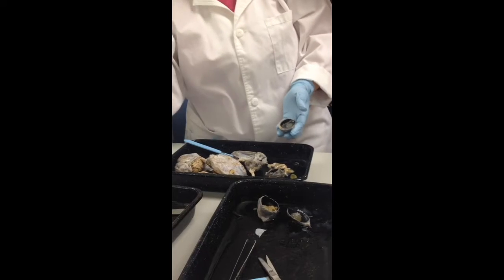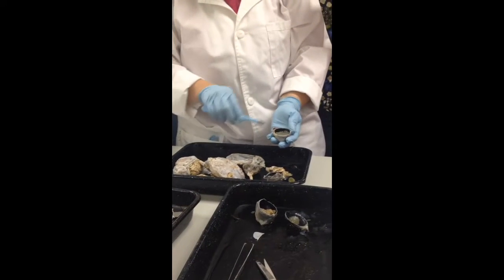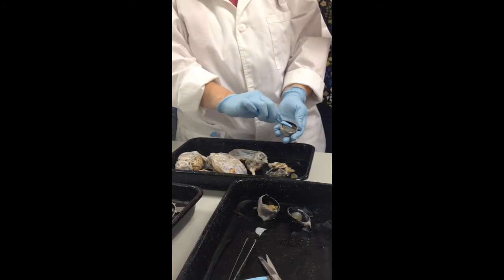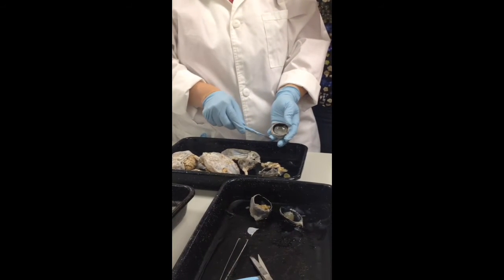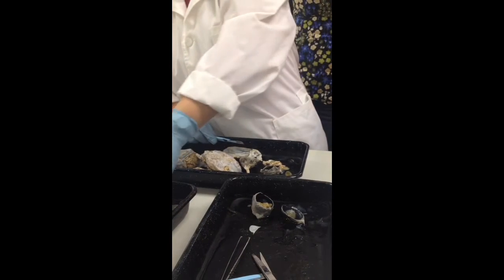Okay, now here you see this nice lining of this brown layer. What layer would that be? The retina. That's the retina. Neural tissue is usually this tannish color. Okay, and the retina gathers up at one point where it becomes the optic nerve. What's that point called? Optic disc. The optic disc, or your blind spot.